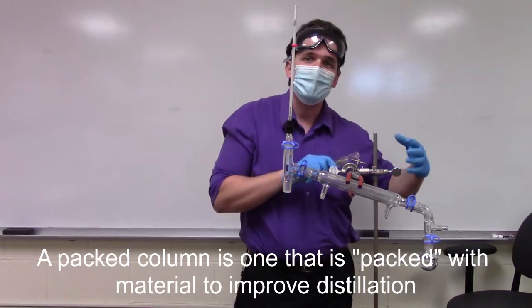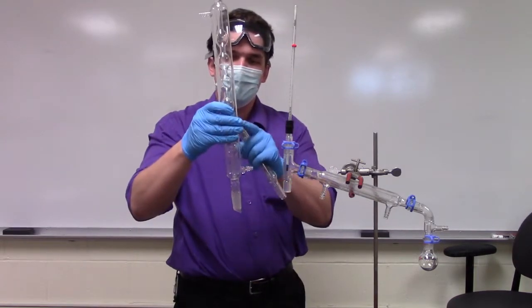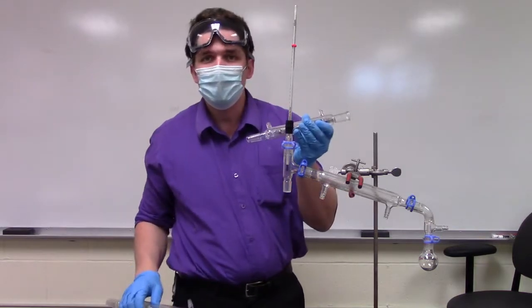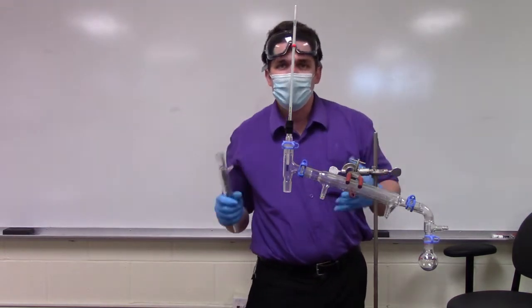Packed columns are basically the extreme of fractionating columns. So whereas a fractionating column like this, you've got one plate for the distillation flask, you've got 1, 2, 3, 4, 5, 6 theoretical plates in here. This can have on the order of dozens to thousands of theoretical plates. So these are your three types of distillations.